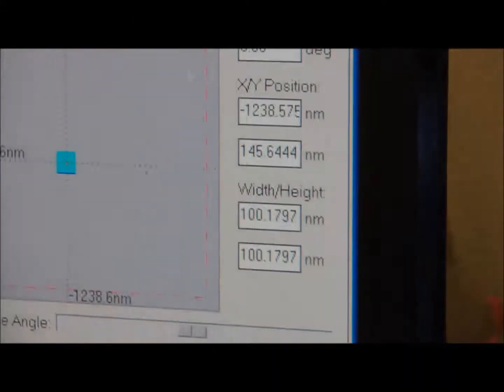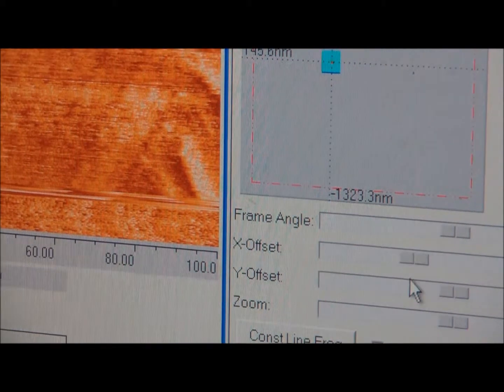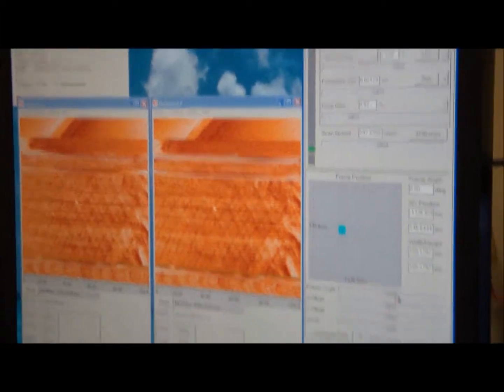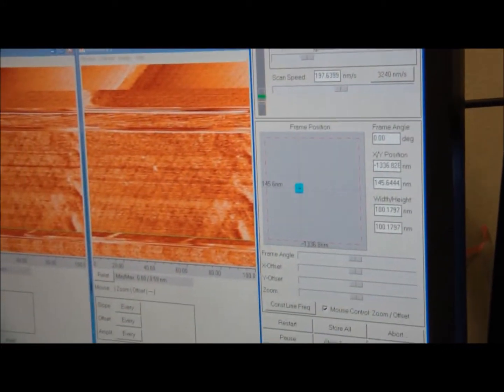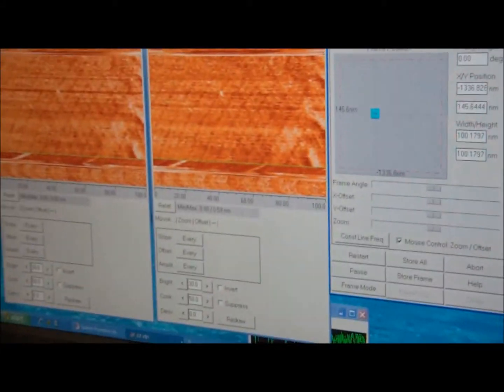On it, then I go down, and then I change the location quickly. Because if we dropped anything, we don't want anything to remain. We don't want to scan over and pick it up again, so we move the location of the tip, and everything's back to its original magnification. And that was a quick pulse that is generally used to fix tips.